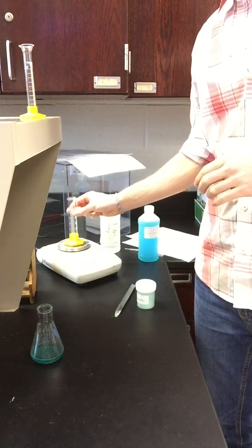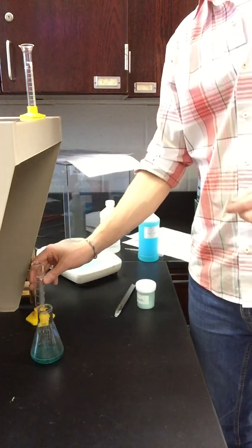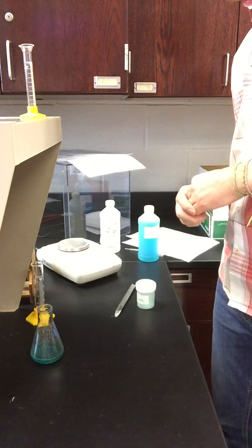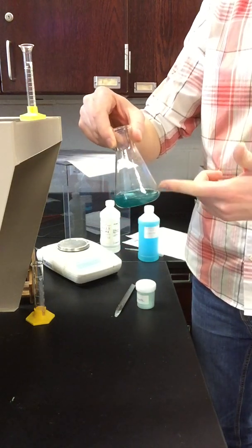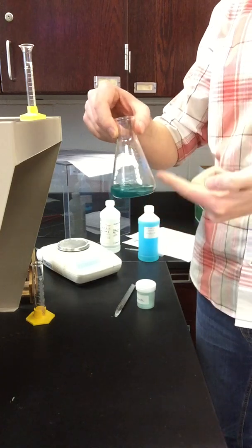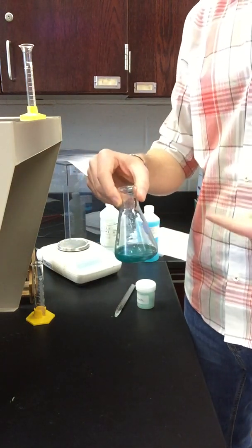46.739 grams is the graduated cylinder by itself with the acid gone. So obviously if you do some subtraction, you can figure out the mass that was the acid. All right, so we've got some things to analyze here. We've got our flask. It has copper carbonate in it, the unknown. It also has acid, and there's a reaction taking place. The reaction has slowed dramatically, but there's still carbon dioxide being given off.